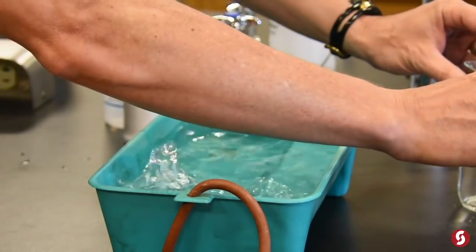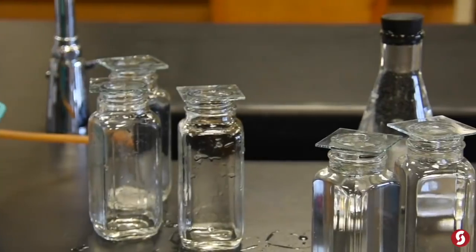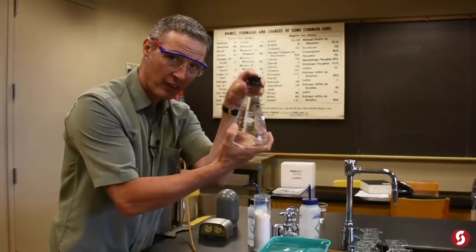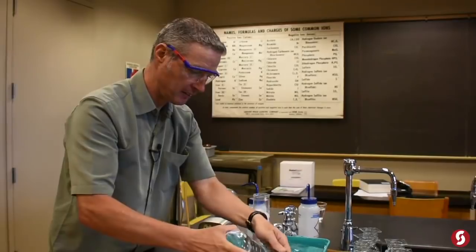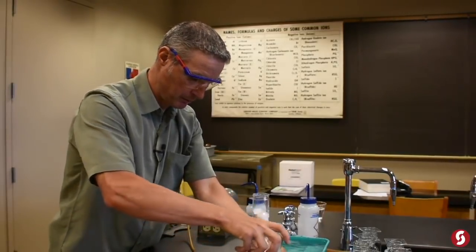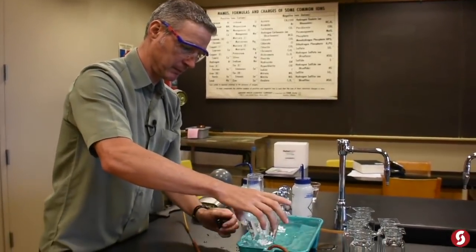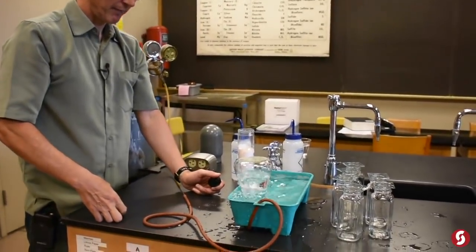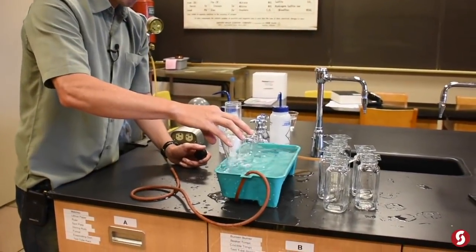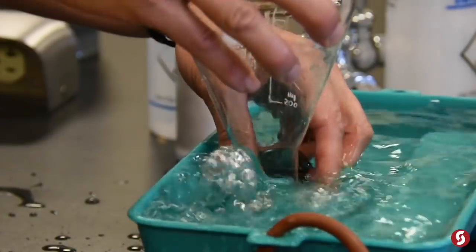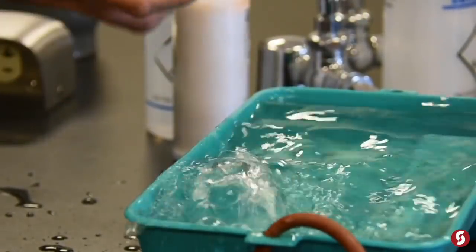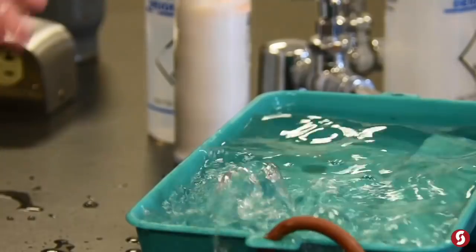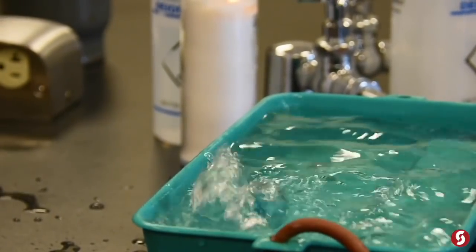But right now, I know that is full of pure oxygen. Save this bad boy for the finale. Five hundred milliliters. All right, let's go to the fume hood where we are going to react some stuff.